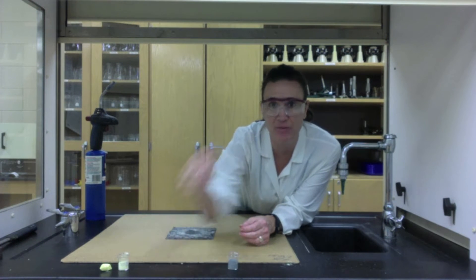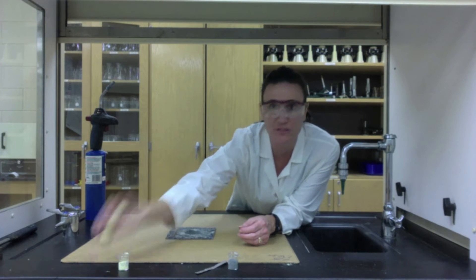What I'm going to show you is how the element zinc and the element sulfur react with a little bit of heat in the form of flame.